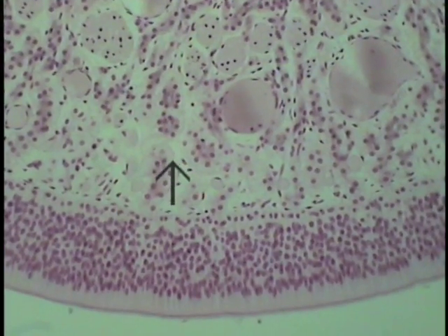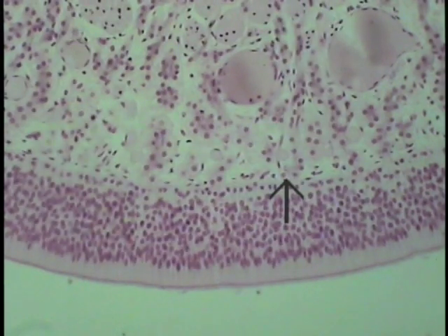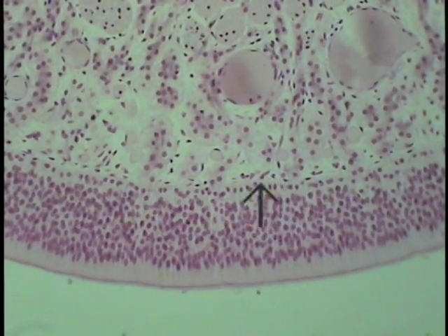And then finally, we actually get to the olfactory epithelium itself, a very thick pseudostratified columnar type of epithelium, extraordinarily thick, beginning where the tip of the arrow now indicates, and then going, of course, to the luminal surface.